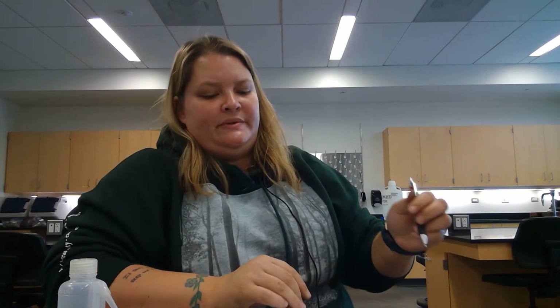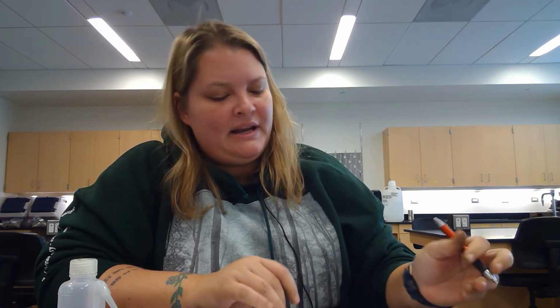We're using the same crucible as we did in part 1, so it still weighs the same. But now we need to know the weight of the crucible and soil that's been moistened to good tilth. For the coarse soil, that is 112.17. So then you can figure out the weight of the soil moistened.